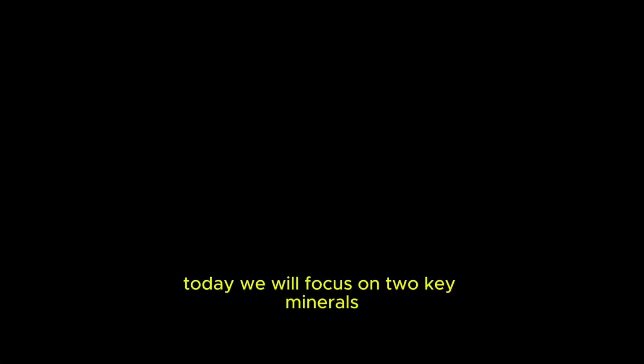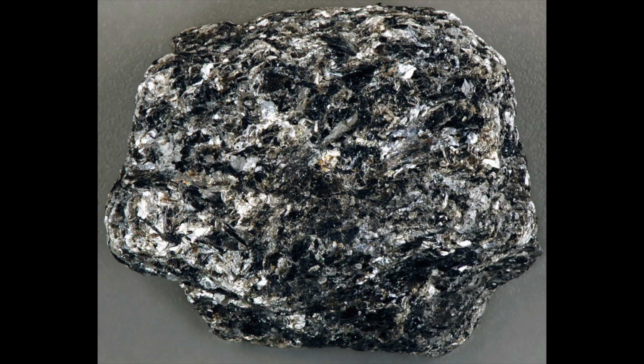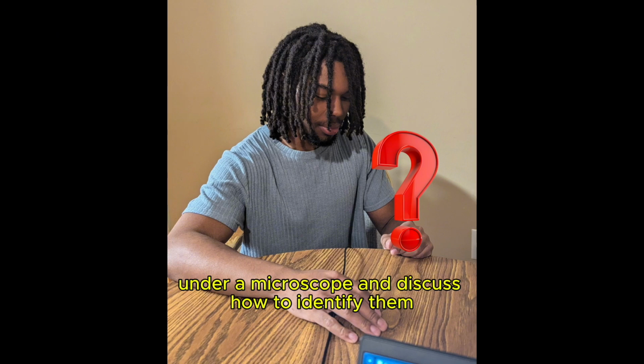Today, we will focus on two key minerals that you may encounter in thin section analysis: biotite and calcite. Biotite is a common mineral found in igneous rocks, while calcite is more frequently found in metamorphic rocks. We will explore how these minerals appear under a microscope and discuss how to identify them.